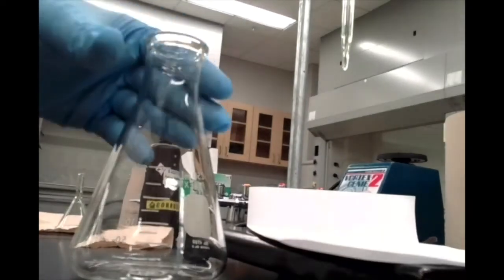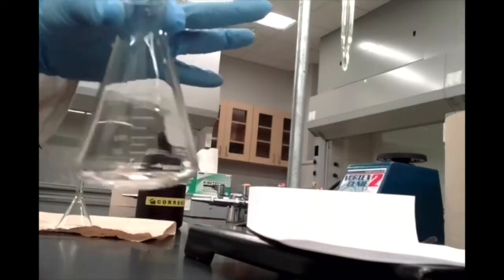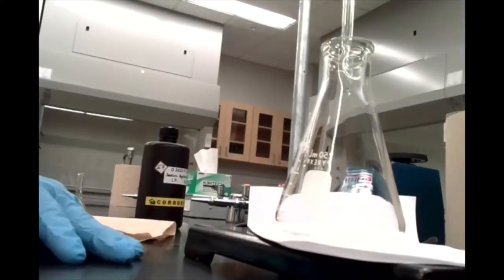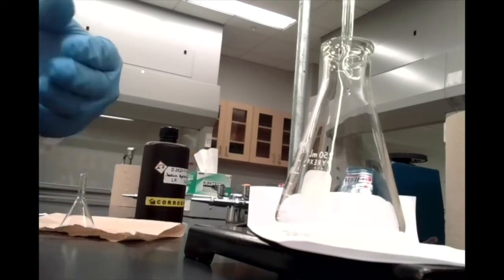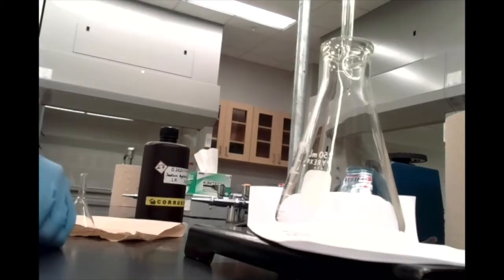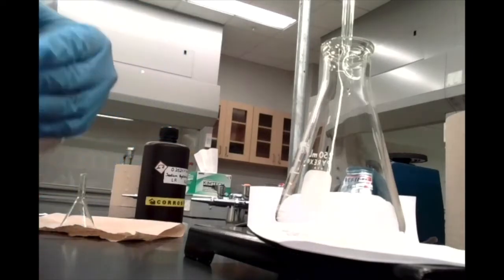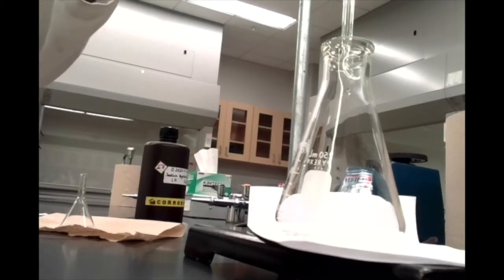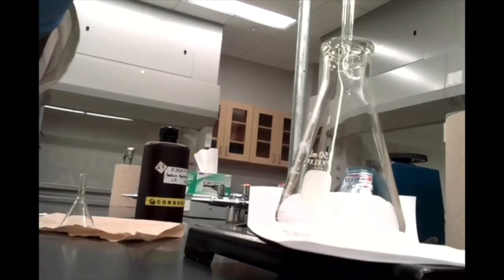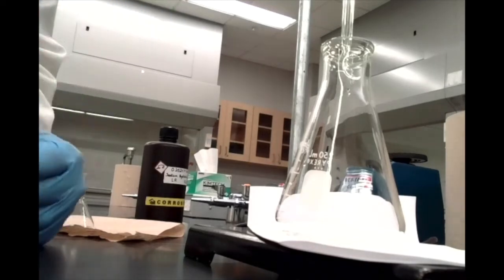All right, so we have our Erlenmeyer flask with our 5 milliliters of vinegar and indicator. I'm going to add that underneath our burette. Since we used less than half of our 50 mils of sodium hydroxide that was in this burette, I'm not going to bother topping off my burette at this point. We're going to start at the same volume we stopped at with our previous trial. Okay, so make a note of that for your initial reading for trial number 2.